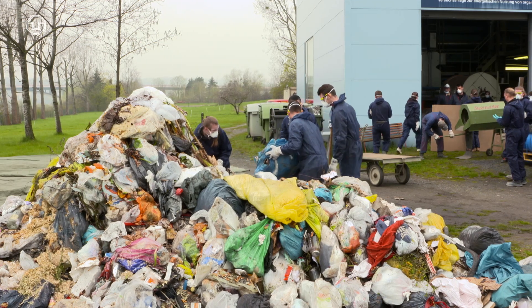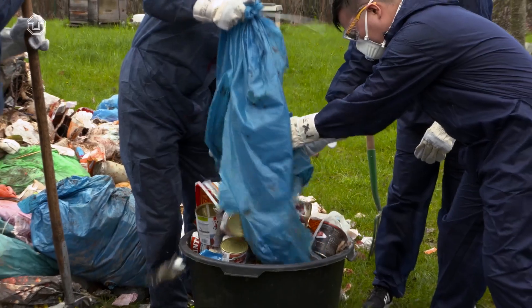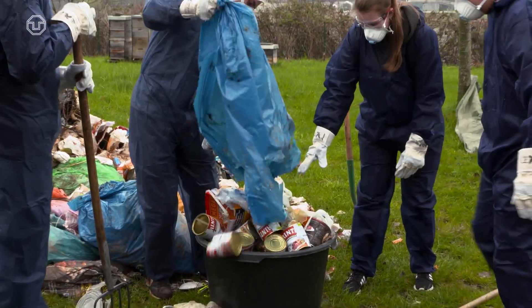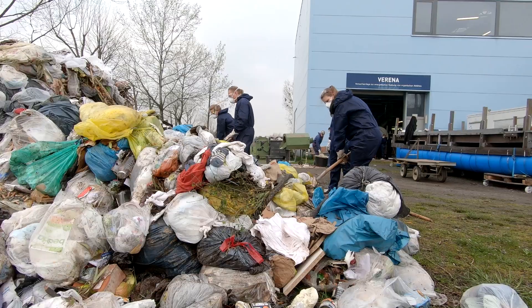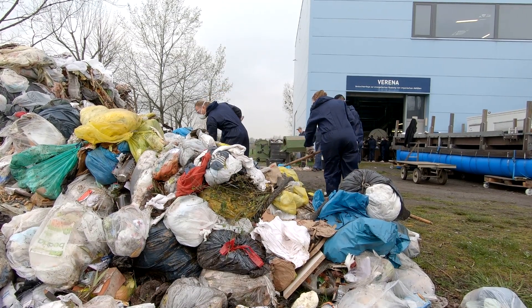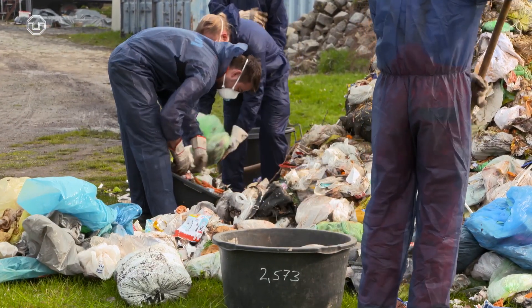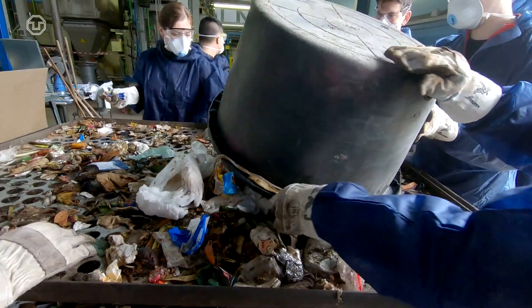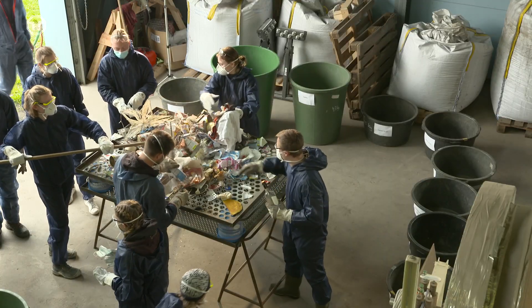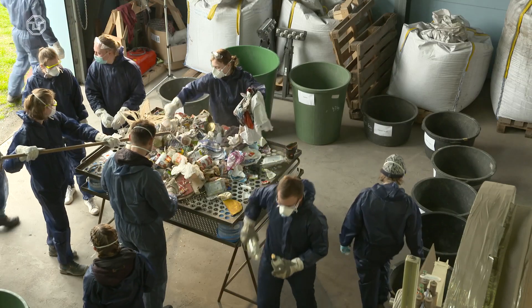Sampling should be as unbiased as possible to take a representative sample. Instead of selecting dominant or interesting waste components, the material should be taken value-free from the waste pile. The sample is then distributed over the entire surface of the table and sorted. The waste should not be forced through the sieve grids, otherwise the result will be influenced.